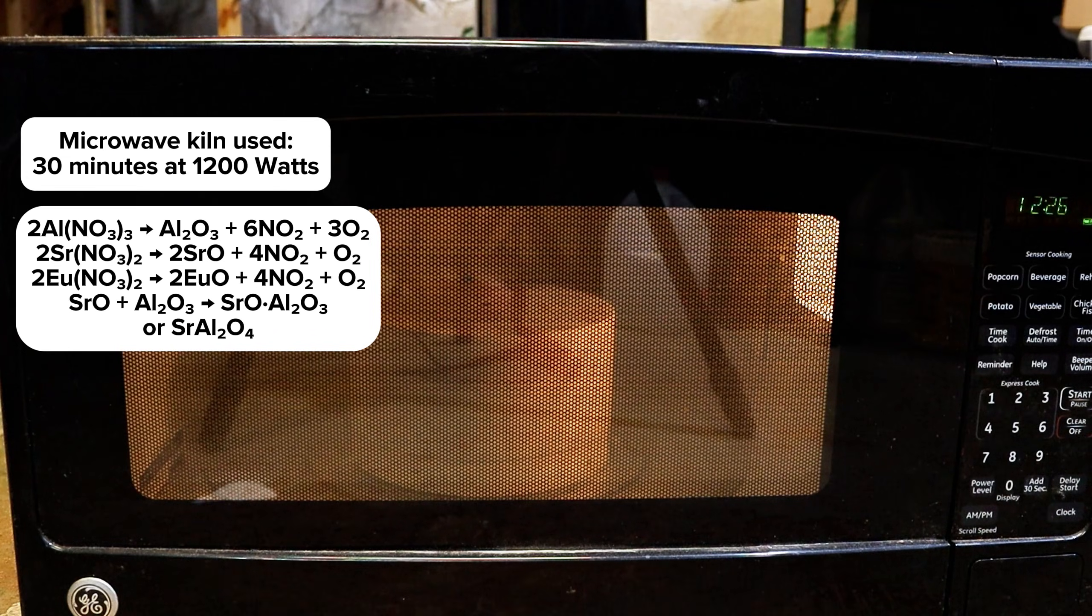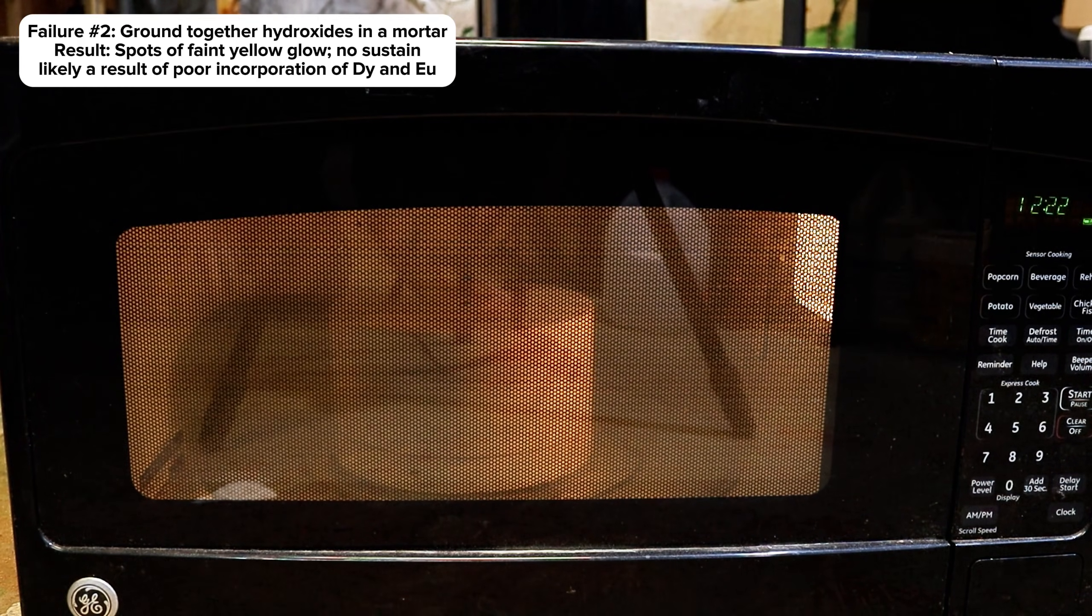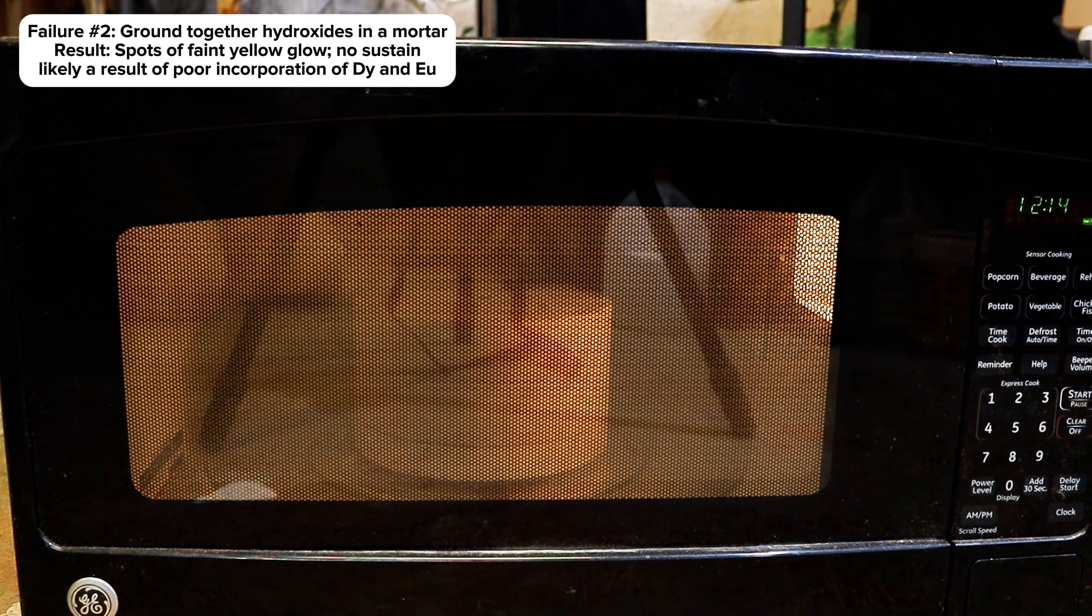At this point I'll go ahead and try to explain my other two failures. For my second failure, I basically tried to simply grind together the 4 reagents in their powder form and fire them directly for 15 minutes. This resulted in a product that had very faint luminescence and was only luminescent at all in certain spots.